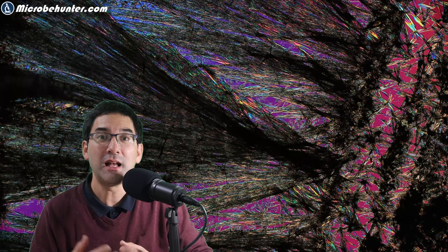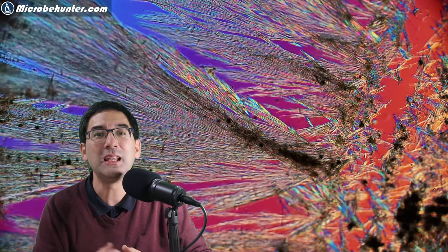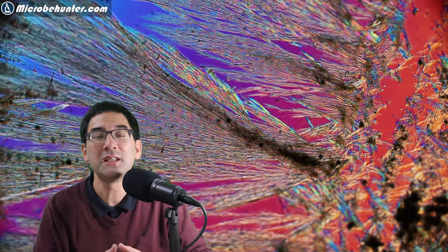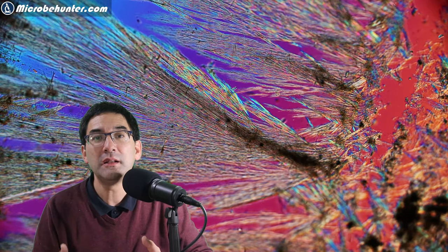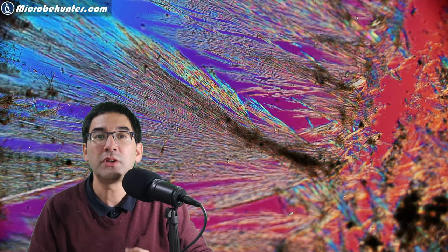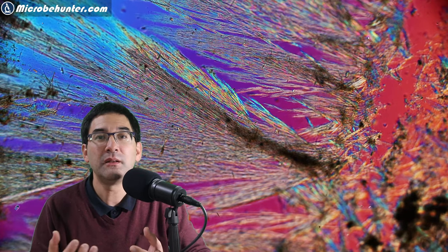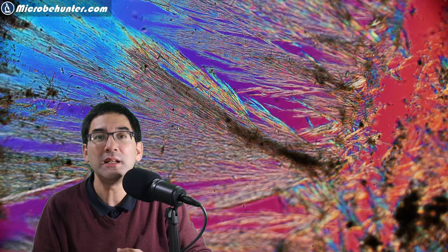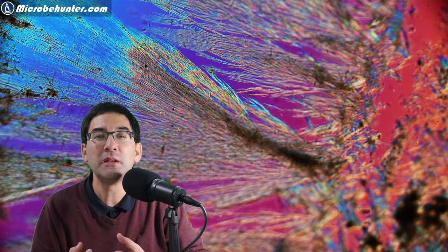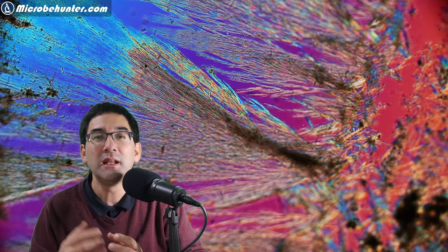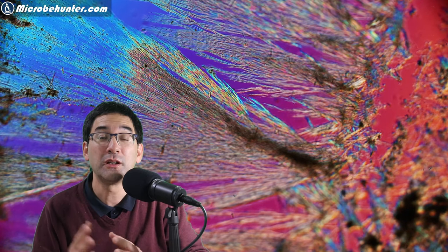Well, back to the crystals here. Now you've seen I've added a little bit of liquid covering the crystals. These crystals form as water containing the caffeine evaporates. As the water evaporates, the solution becomes saturated, and as more and more water evaporates, the crystals cannot be held in solution anymore and they start to aggregate, forming those beautiful colorful crystals.